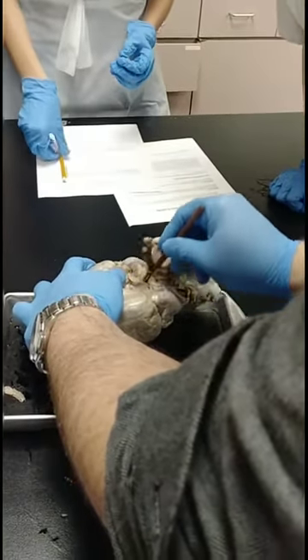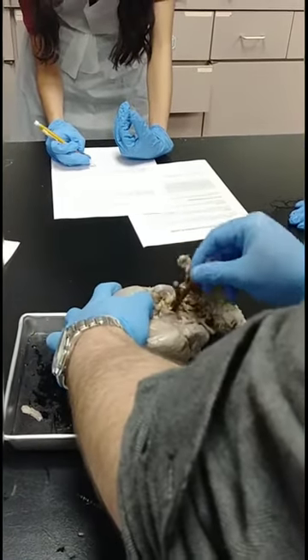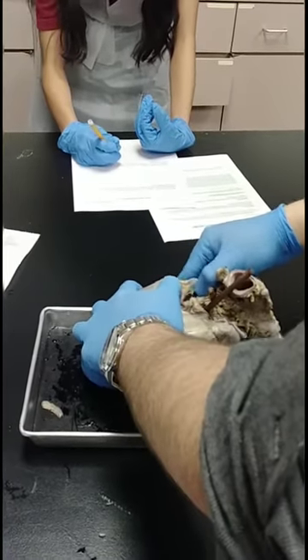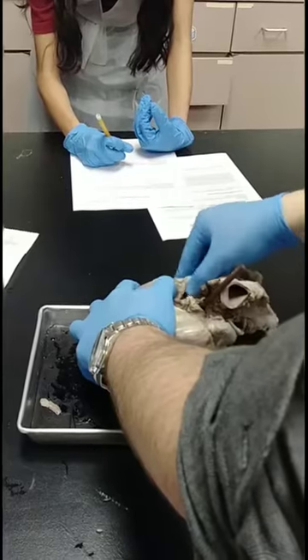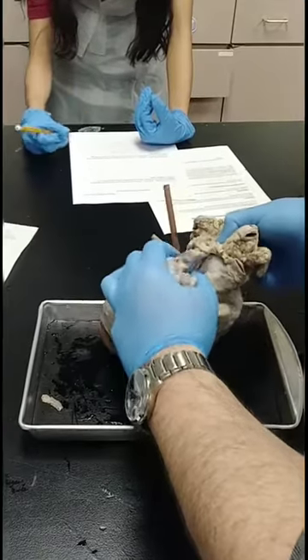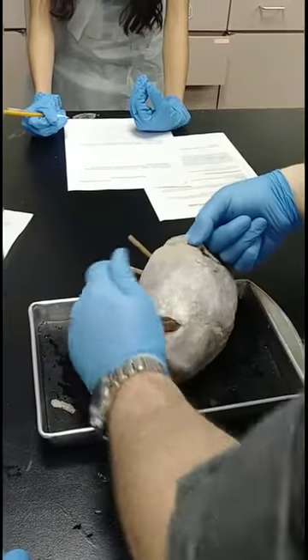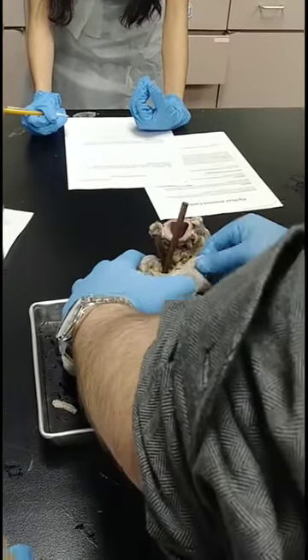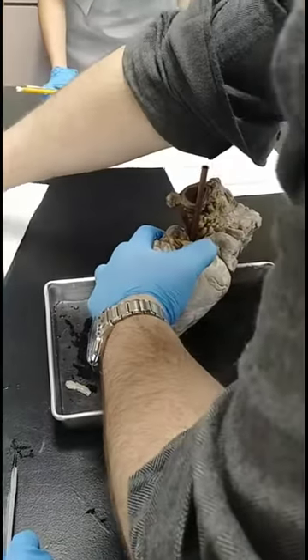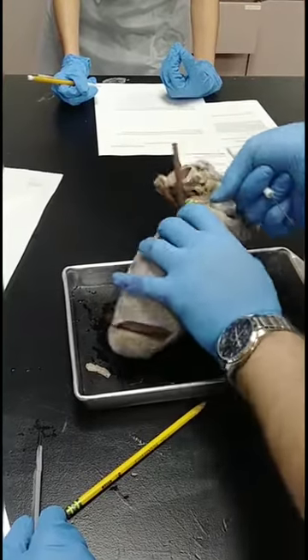The only thing it's doing is returning blood to the heart. It's very thin. If it's thicker, it's some sort of artery — remember we have a pulmonary artery to worry about — but veins return blood back to the heart. This would be the pulmonary vein. The pulmonary artery is going to the right side of the heart. Mark that.